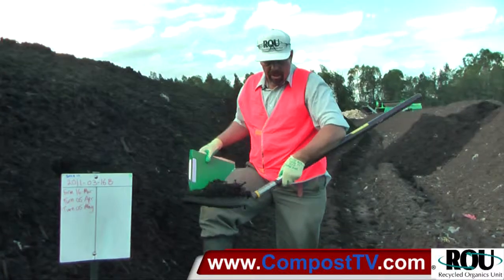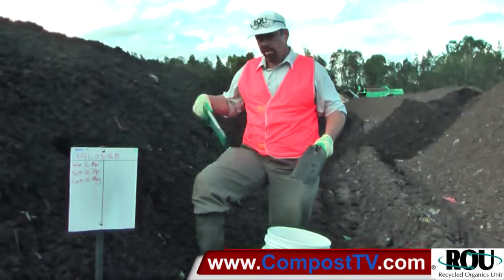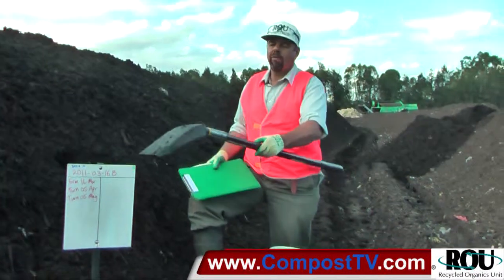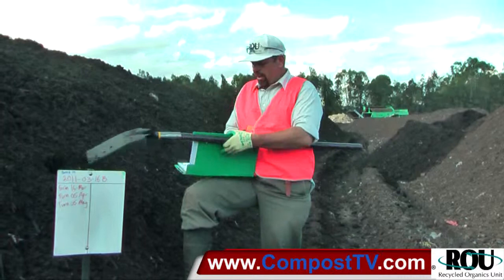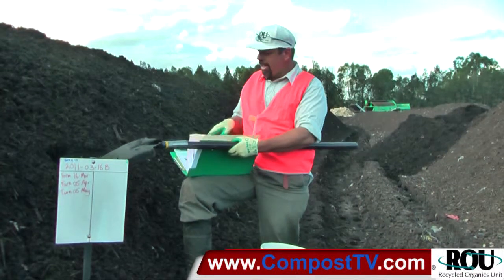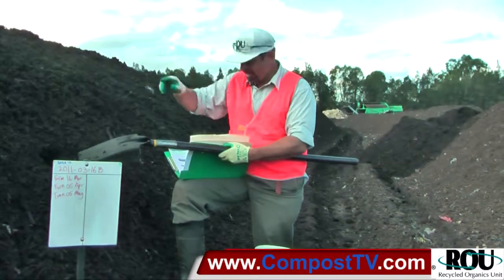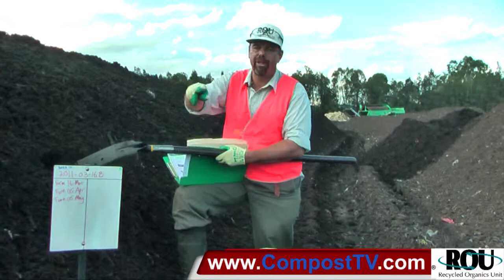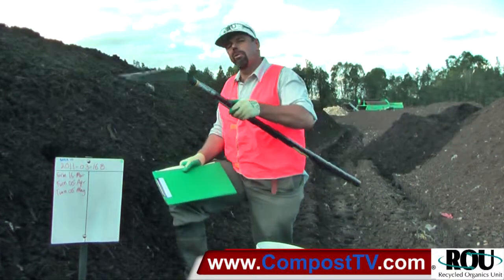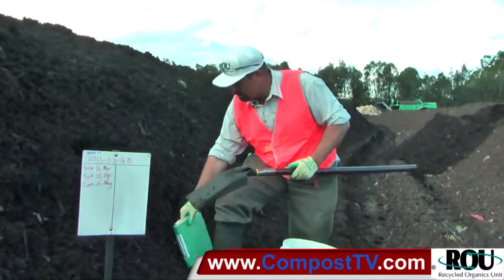So back to the pile now. We need to make sure all our materials are clean — clean spades, clean buckets. We need to make sure we're sampling from the right windrow. I've got my batch form here that I'm tracking my material with, and I've checked I'm at the right windrow. On my batch tracking form I'm identifying that I'm sampling, and on my sample prep form I'm identifying that the sample I'm going to label and send to the lab is from this windrow. So we can backtrack right through the system and know the results will be attributable to this pile of compost, and that the sample was representative of the material in this pile.